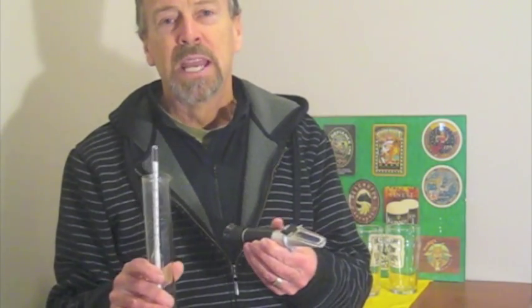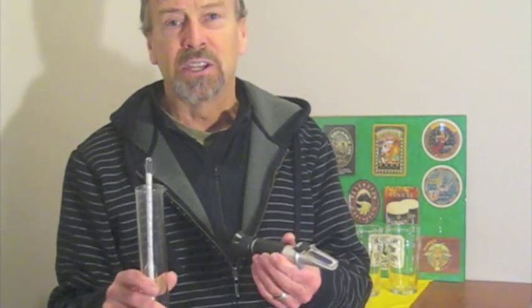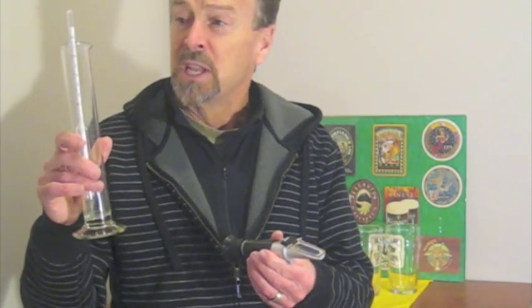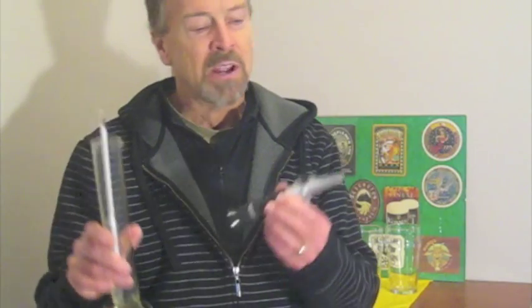So I thought I'd set up an experiment, have a controlled environment today to do that, and then actually replicate this during my brewing day to really measure the value of the time-tested hydrometer versus the benefits and the attractiveness of using a refractometer. So let's go take a look at the setup, and I'll show you what we're going to do.